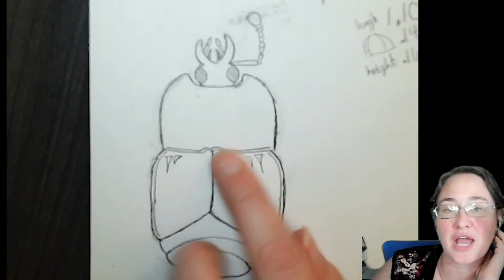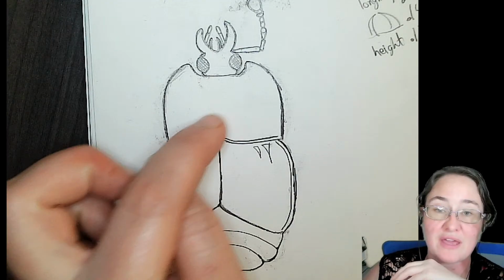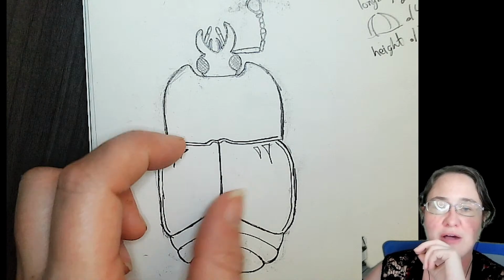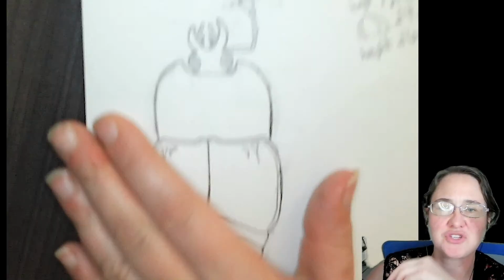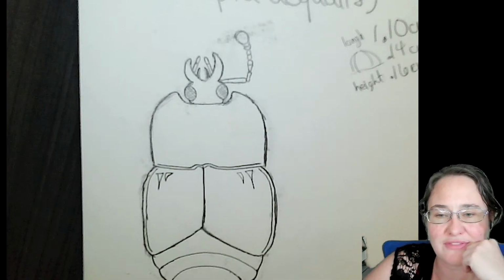I'm pretty happy with the head, the thoracic region. This is just the first segment of the thorax. The thorax actually continues down probably to about the end of the elytra here. Ooh, I'm noticing I have to fix those glares. But that gives us a really decent body shape, and now all we have to do is add these legs.